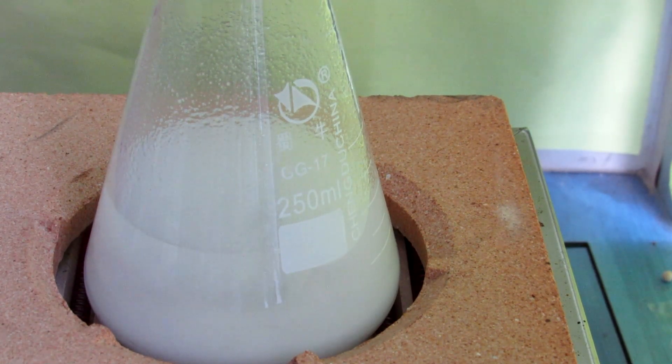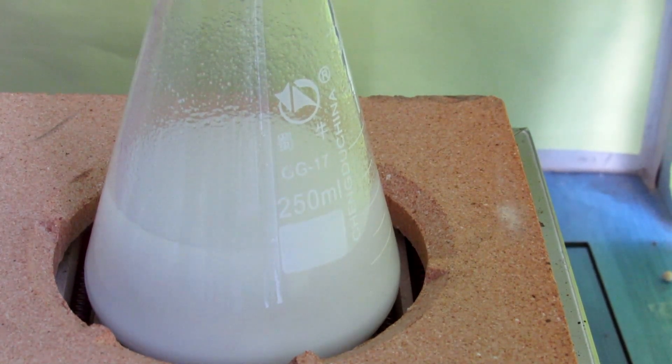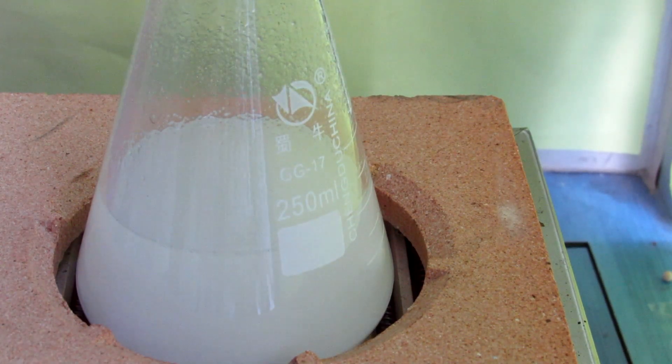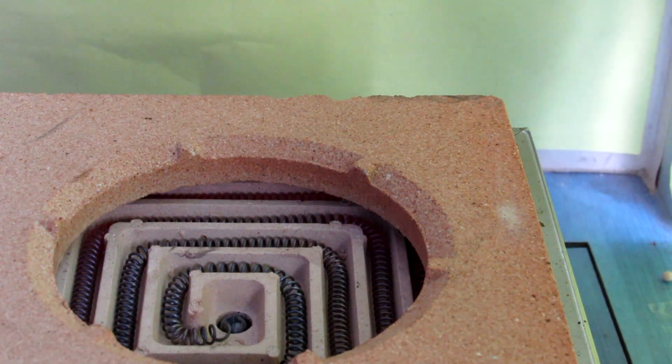But this was probably way too much, as you can see later in this video. It seems that the carbonate is not going to fully dissolve, but it shouldn't matter.